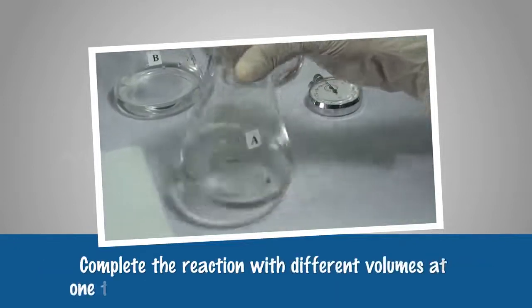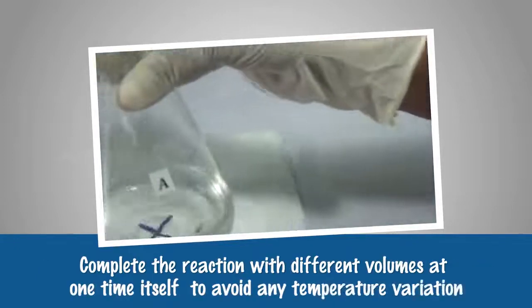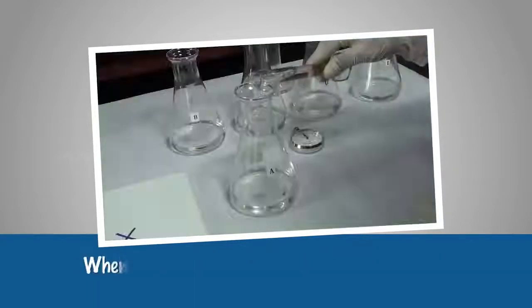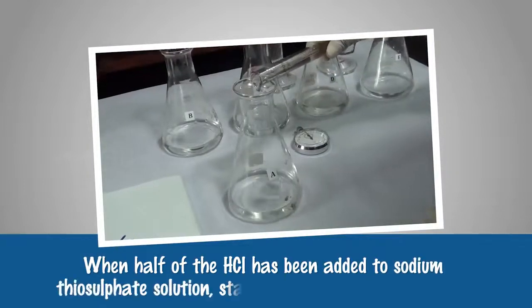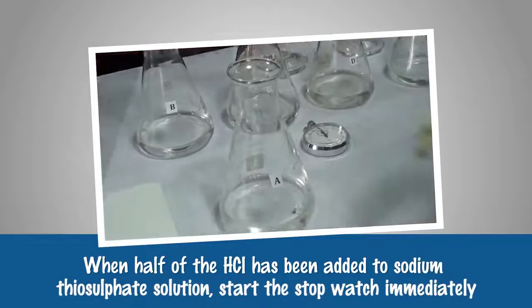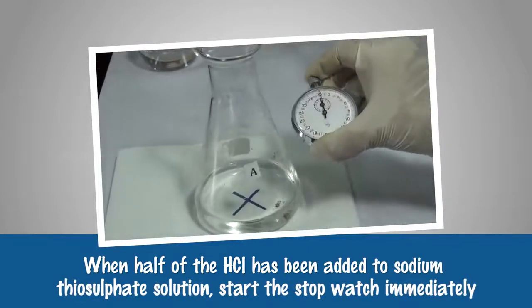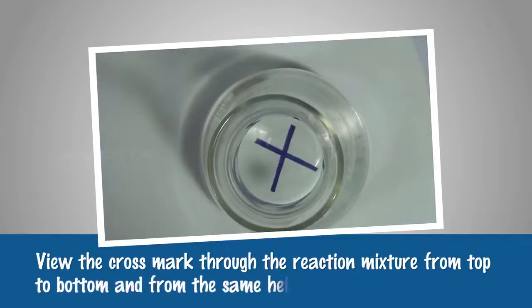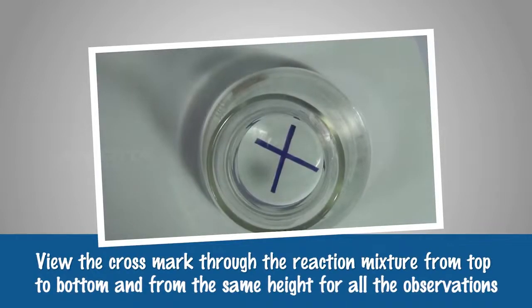Complete the reaction with different volumes at one time itself to avoid any temperature variation. When half of the HCl has been added to sodium thiosulfate solution, start the stopwatch immediately. View the cross mark through the reaction mixture from top to bottom and from the same height for all observations.